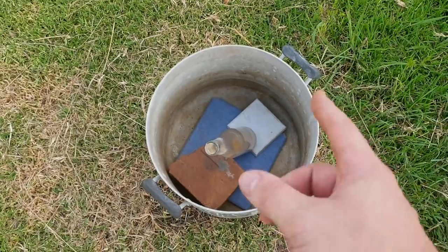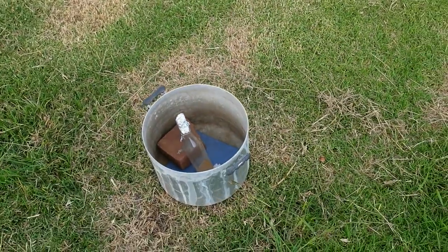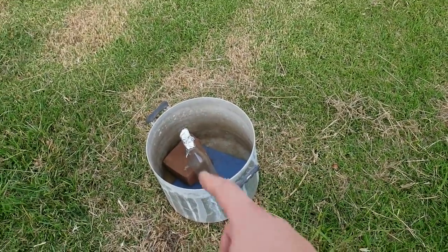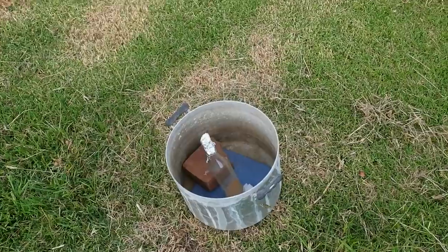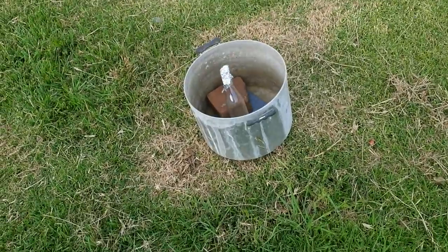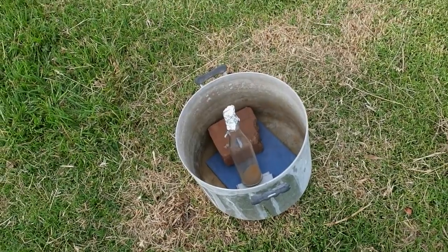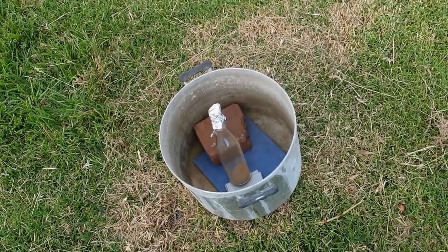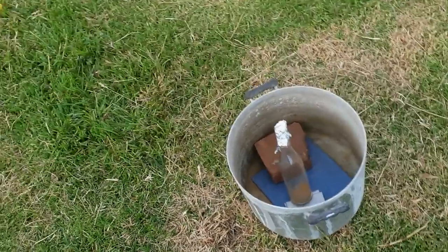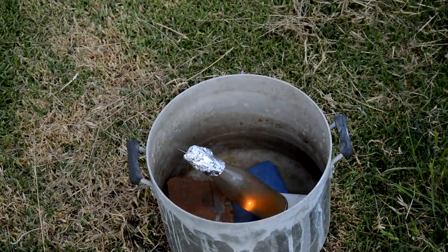So I'll just go get the fuse and the lid. I was going to put the lid on, but obviously the big lid covers everything and then you can't see anything being filmed. I thought about how much you wouldn't enjoy me putting that lid on and not being able to see any fire. So yeah — we've got the camera here, hopefully it's far enough away. Hopefully the glass contains at least the fireball, so even if the glass shatters it resists the metal getting sprayed everywhere. I've got some degree of confidence it won't spray everywhere, so let's leave the lid off and get some cool film. Let's do it.